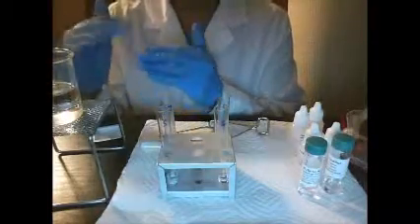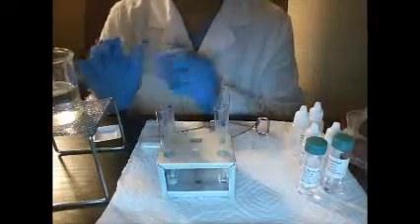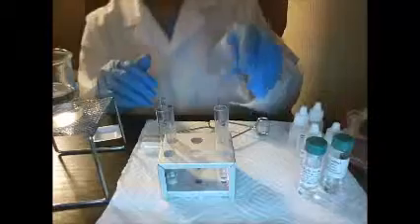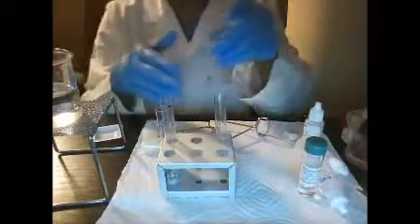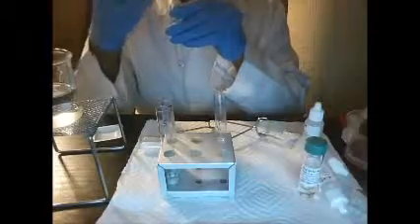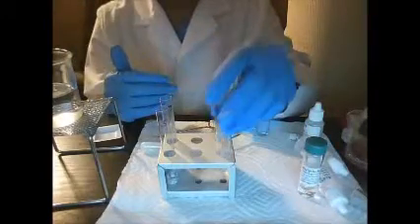So I repeated what's part 1 of the synthesis of fragrance esters. I added 20 drops of the water from the beaker into each test tube. And now we're going to test the fragrance. So this is test tube number 4 here. Test tube number 4 smells like an apple scent.